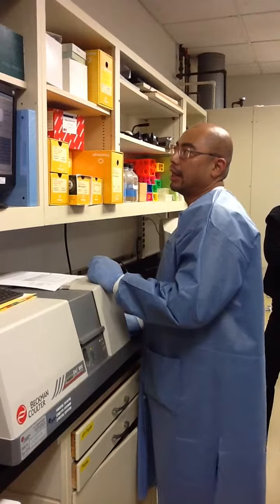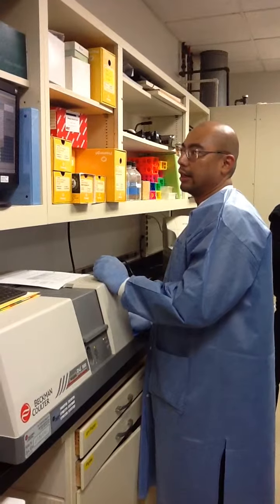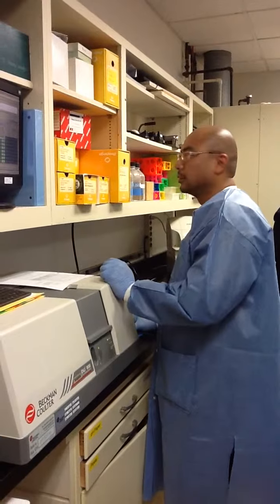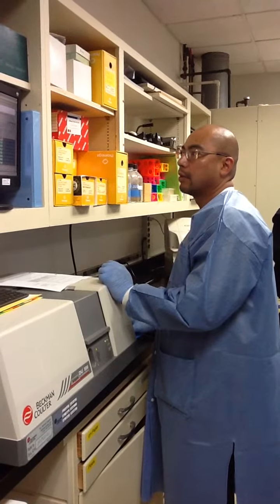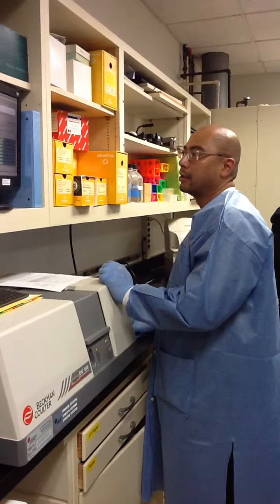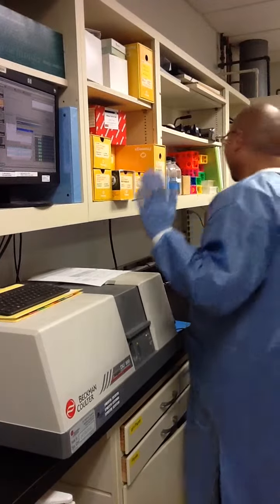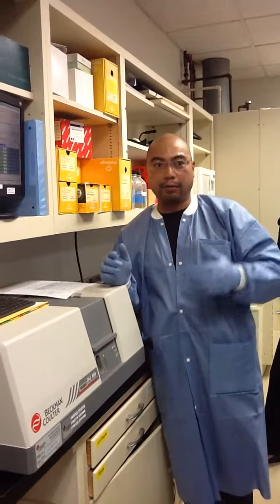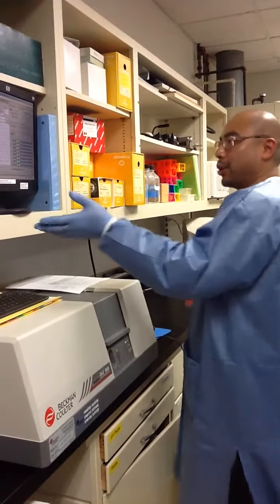So I programmed it in, and all I'm going to do is hit start, and hopefully it'll start to read our data. That's like music to the ears whenever I hear that. It has these two programs that go in there, and it says this is not calibrated, and it's like, oh, yes. But now it's starting to run.